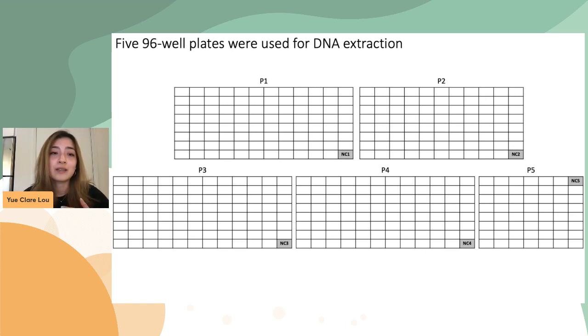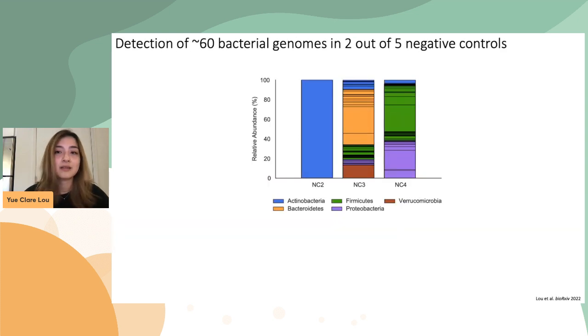However, we saw at least one organism in NC2, NC3, and NC4. Here I'm showing you the taxonomy breakdown of the genomes that were detected in these 3 negative controls. These genomes were colored by phylum, and the black lines represent individual genomes within each corresponding phylum. As you can see, while NC2 only had 1 genome, NC3 and NC4 had about 60 bacterial genomes.